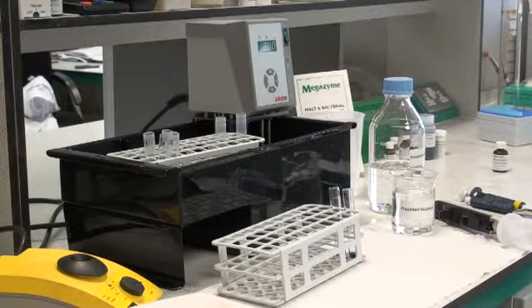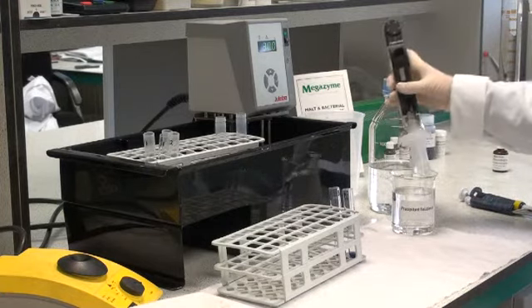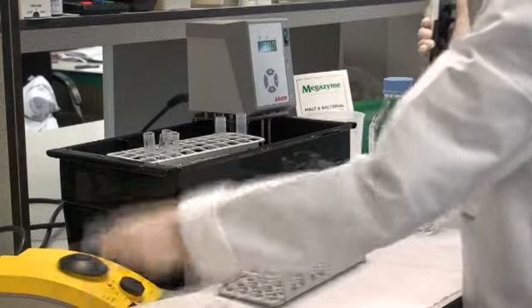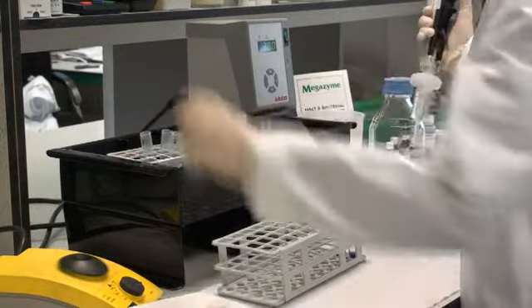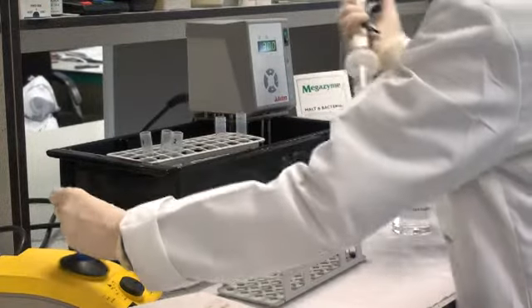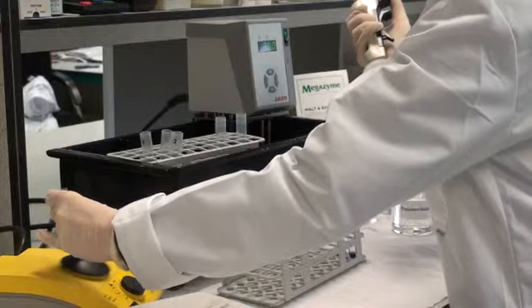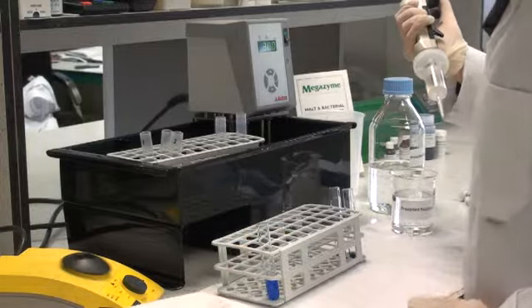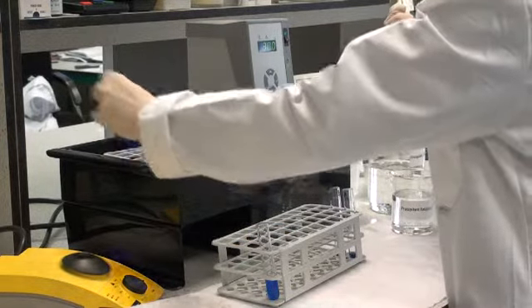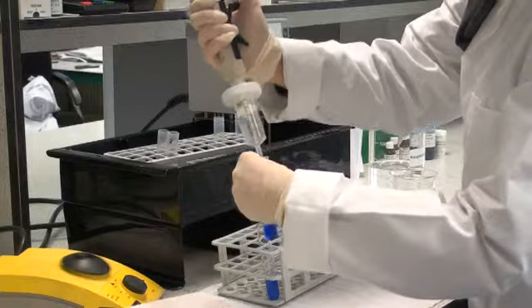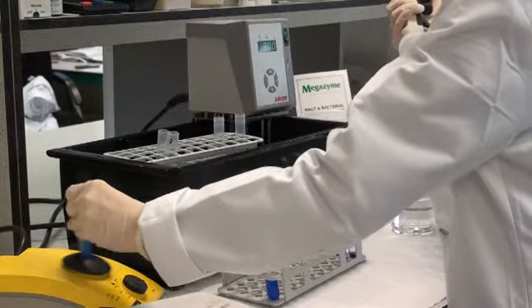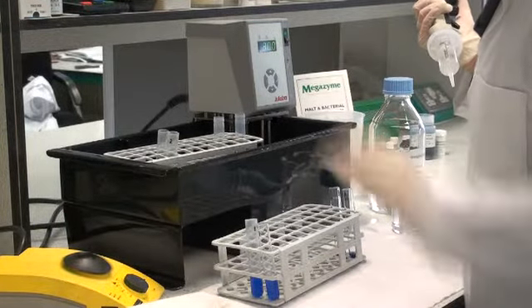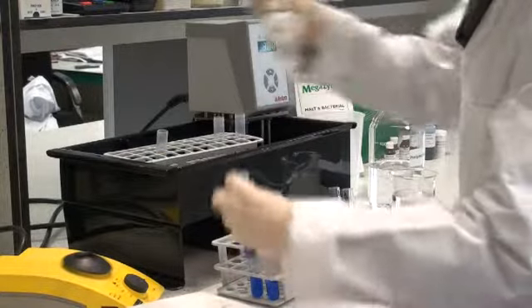At the end of the 10 minute incubation period, the reaction is terminated by adding 3 ml of precipitant solution A. This is added to the tubes on 15 second intervals, exactly the same sequence as in which the reactions are started. The tubes are stirred extremely well on the test tube stirrer and they're placed in a rack at room temperature.